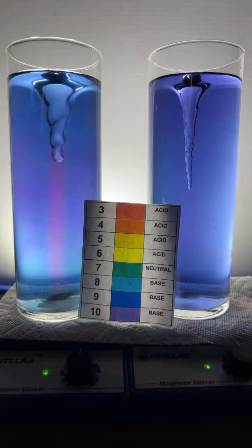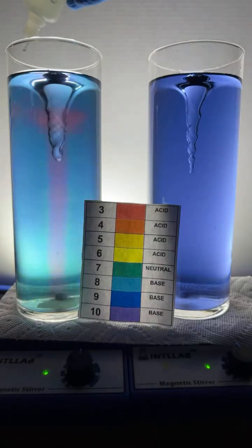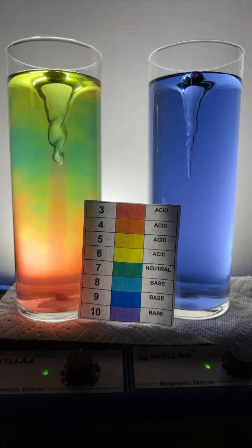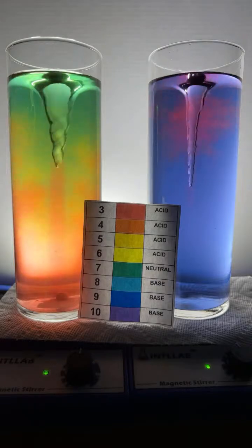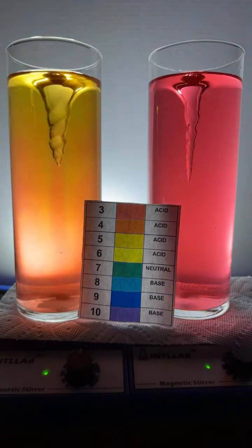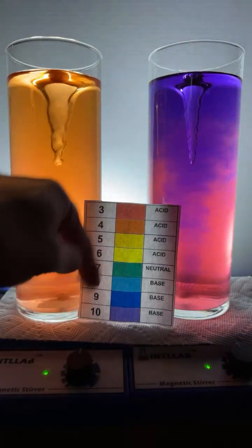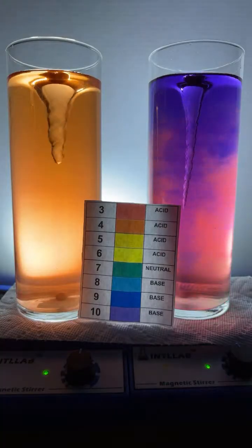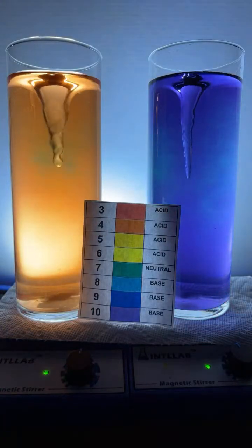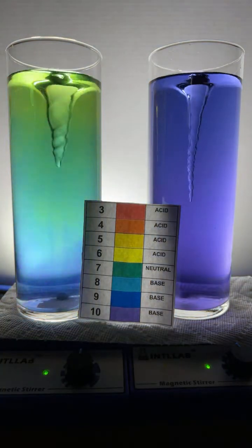Got a little rainbow action going. I think we're able to get the rainbow a little bit better over here on the left. Yeah, that's pretty. Very pretty. A little bit of acid over here on the right-hand side. Now we're going to start adding base because we're at the low pH range. I want to change the color, so I've got to add base to get it heading the other direction. Looks like we're at about pH 4 over here. Yeah, an orange color. Let's add a little bit of base over here. We're going to have to add a bunch more because this system's buffered.